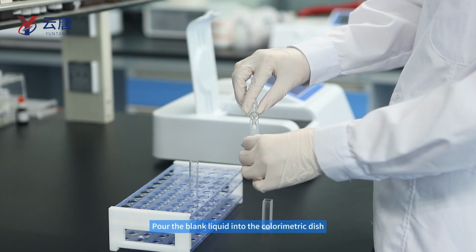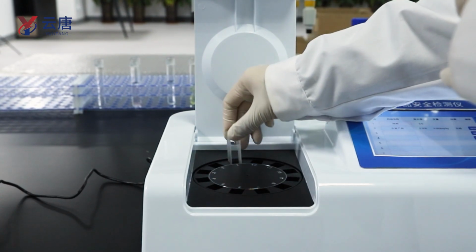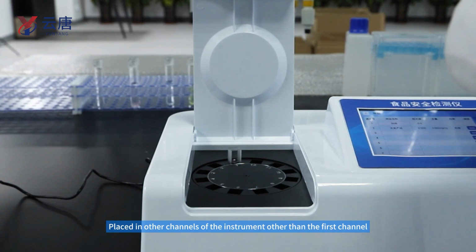Pour the blank liquid into the colorimetric dish. Place in the first channel of the instrument. Pour the solution to be measured into the colorimetric dish, placed in other channels of the instrument other than the first channel.